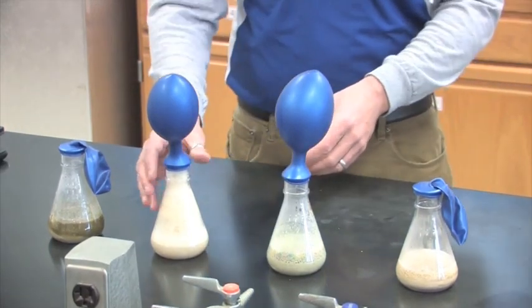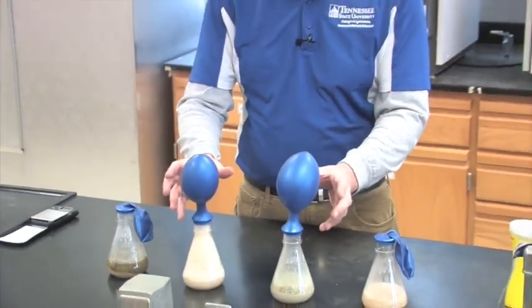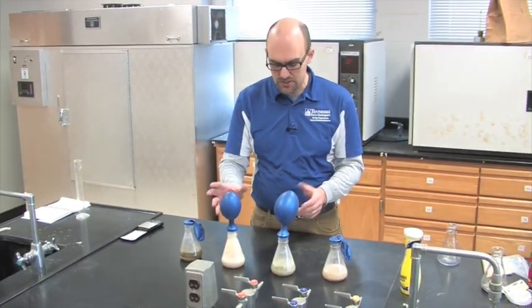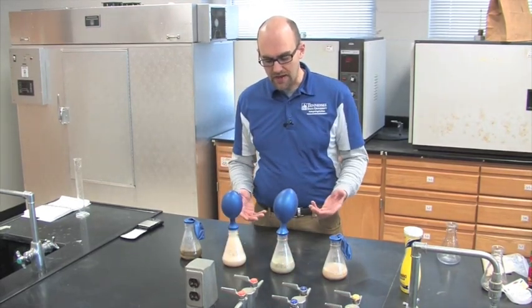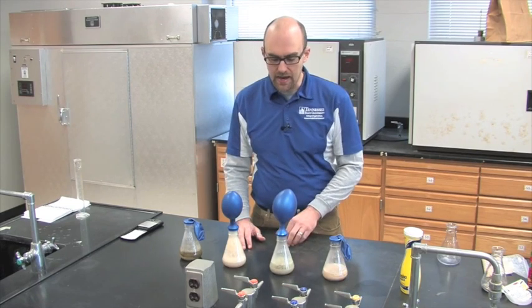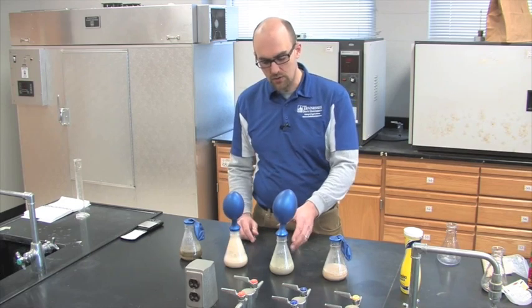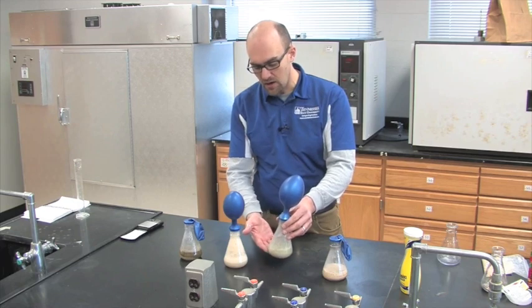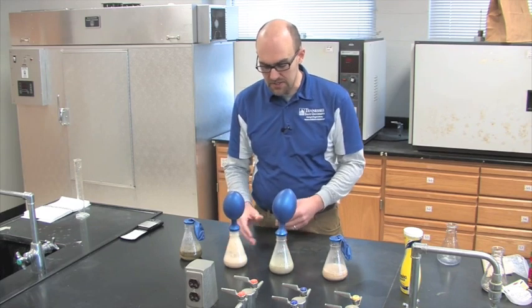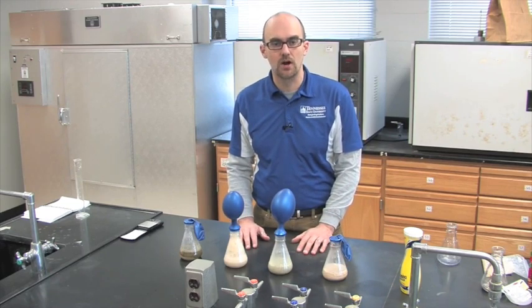When we're talking about available sugars for the sugar itself and for the higher sugar cereal — the Fruit Loops — we've definitely got some CO2 production. It might look like the Fruit Loops balloon is a little bit larger than the straight sugar, which you wouldn't necessarily expect. One factor might be that we added water to that flask a little sooner, giving it extra time to react and produce more carbon dioxide. Also, there may simply be plenty of sugar in both flasks for the amount of yeast added, so there's not much difference because the yeast in both have enough sugar to produce all the ethanol and carbon dioxide they can.